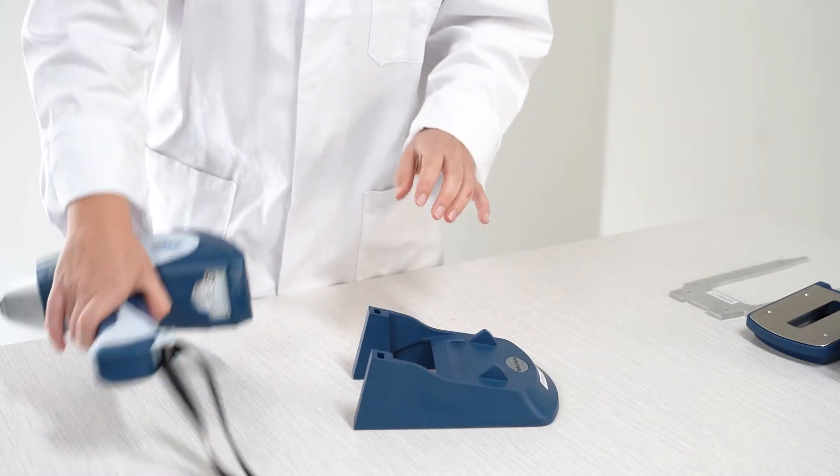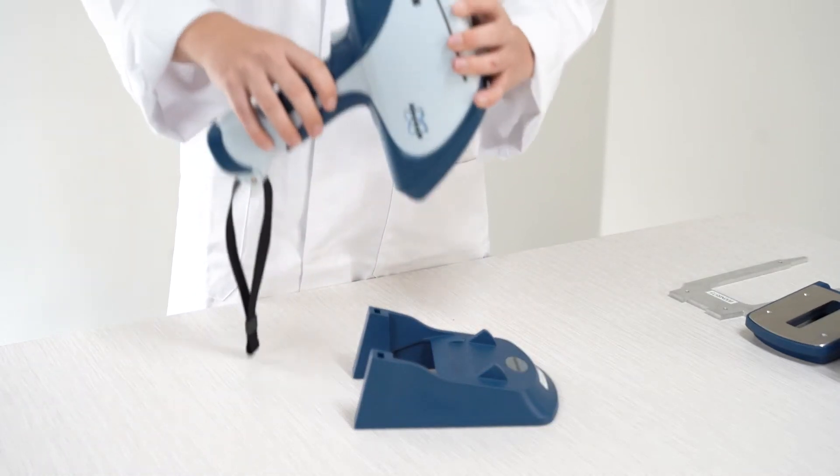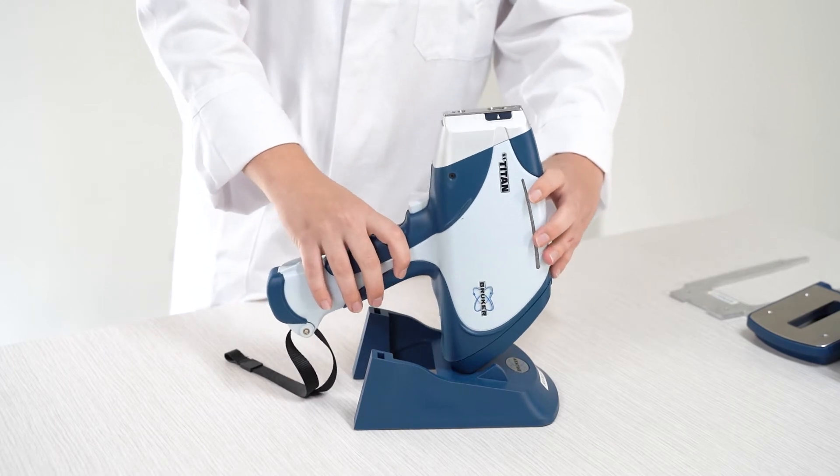With the instrument, rest it on the in-built recess with the two protruding triangles. Continue to hold the instrument for stability.